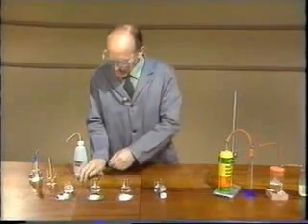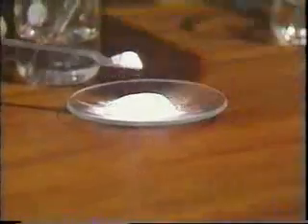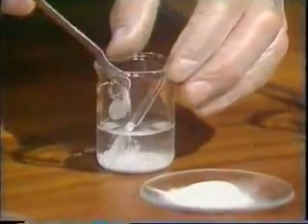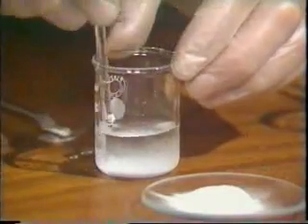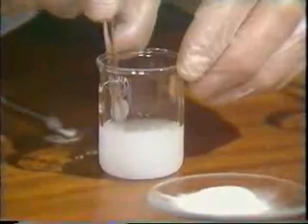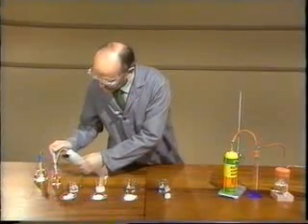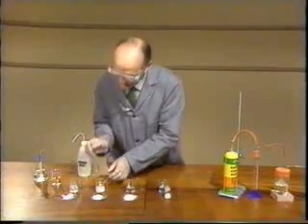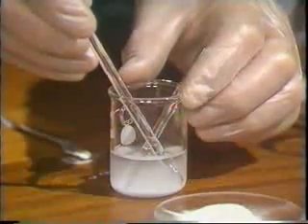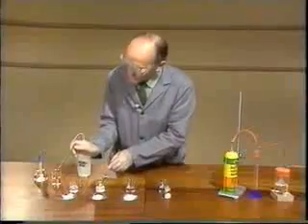Now let's try aluminium oxide. Aluminium oxide is also a white powder, and if I put some of this in the water and stir, again very little seems to be happening. But I'll check the temperature. Rinse the thermometer, and again the temperature is still 22. There's no sign of any change. We'll come back to these to measure the pH later on.